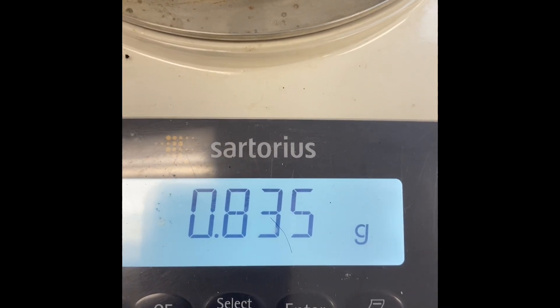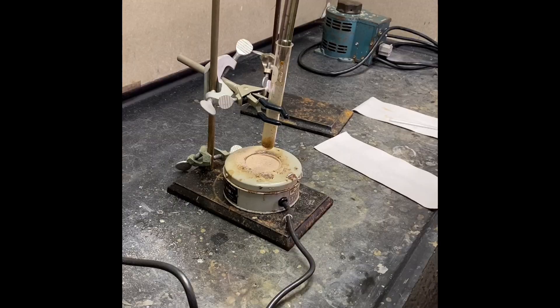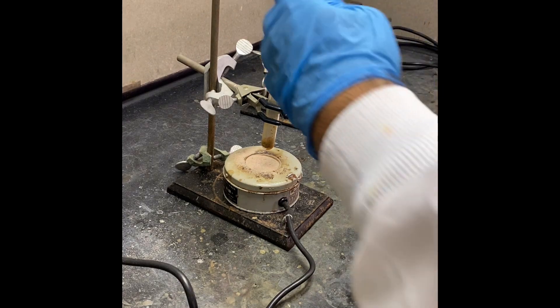That's the first reaction product and the amount. We transferred the first reaction product to the same reaction flask we used in the first step.